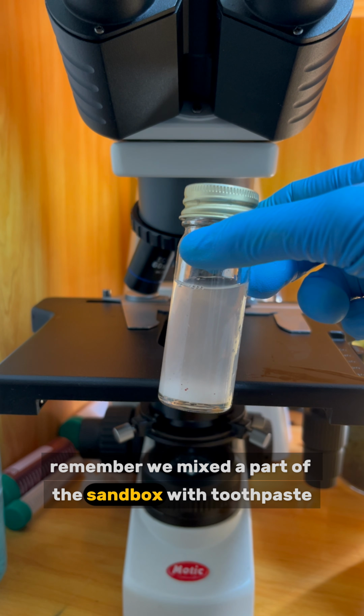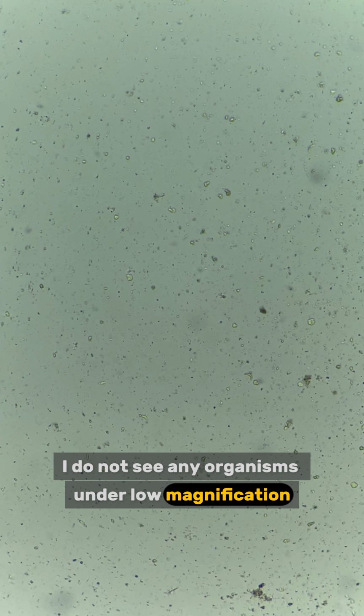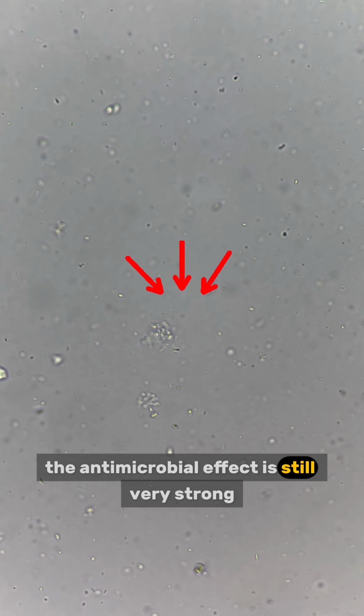Remember we mixed a part of the sandbox with toothpaste? Let's check the result. I do not see any organisms under low magnification. When I zoom in, I can still see a few bacteria swimming. The antimicrobial effect is still very strong.